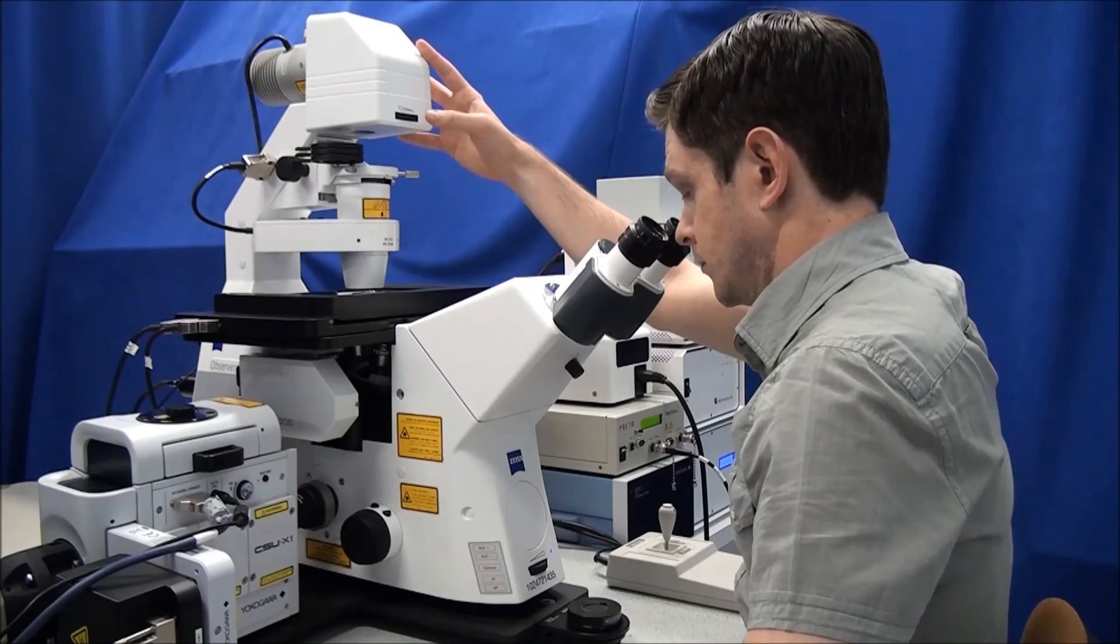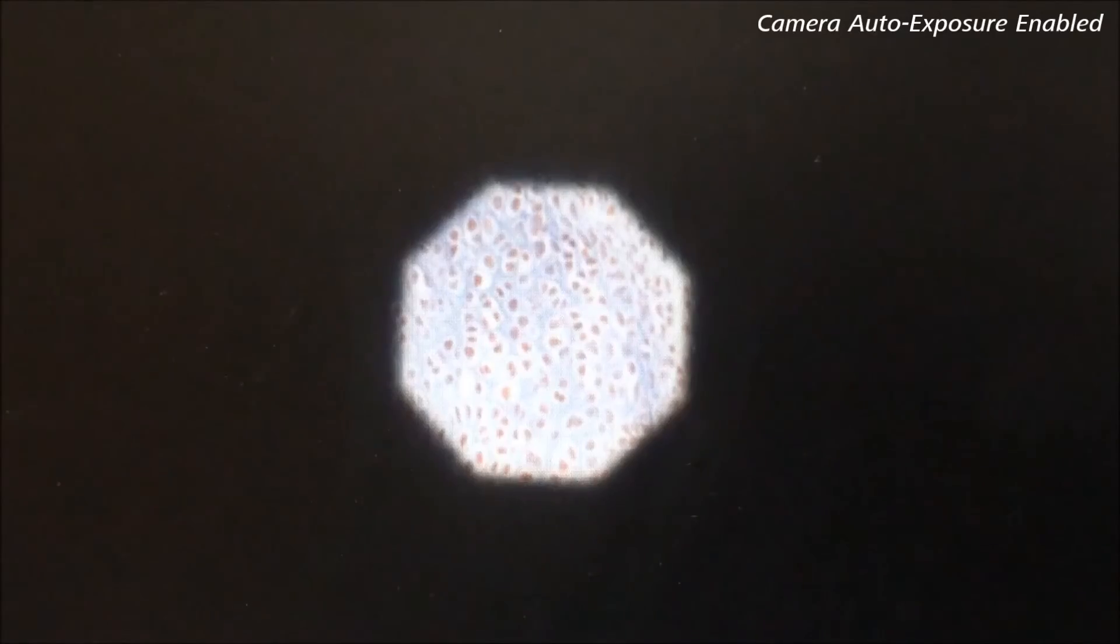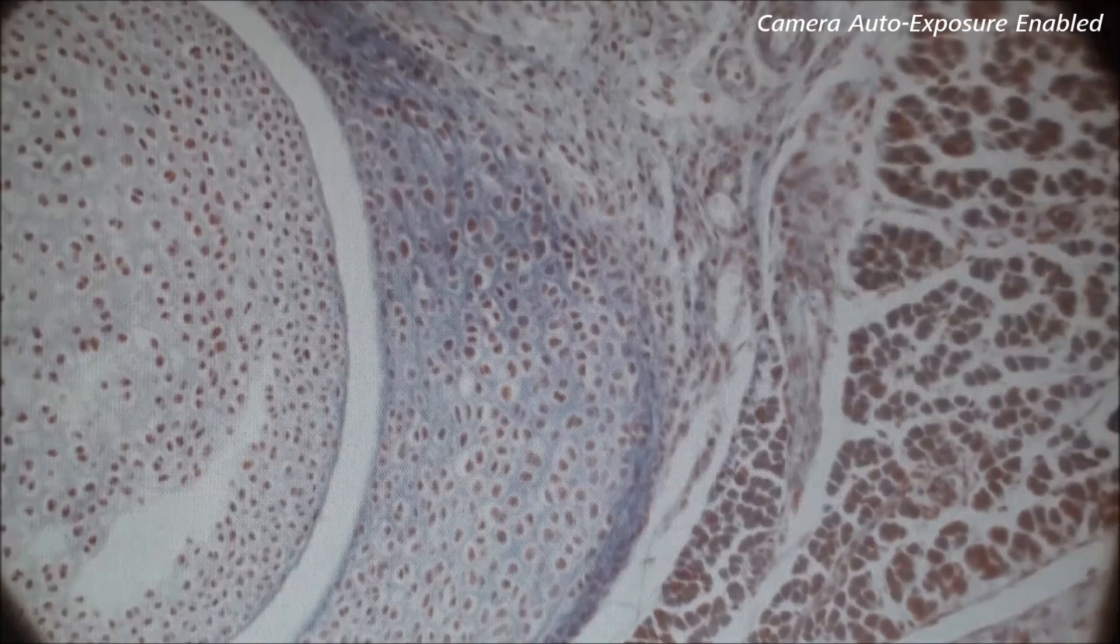Reopen the diaphragm by rolling the field diaphragm control to the left. Open the diaphragm until the image of the blades just leaves the field of view.